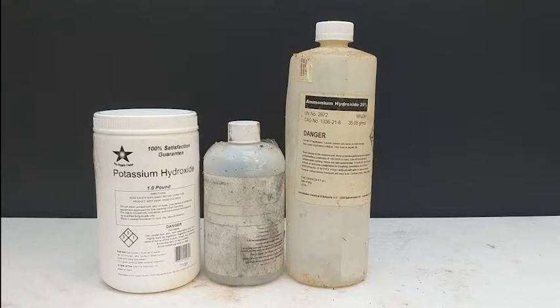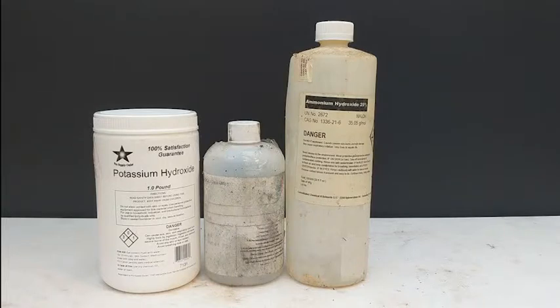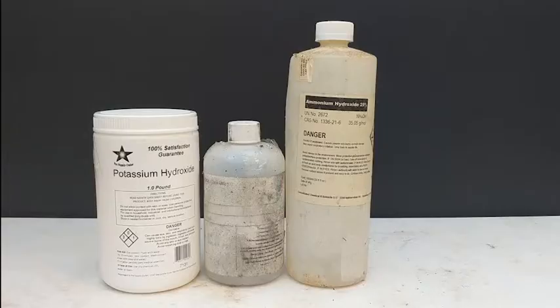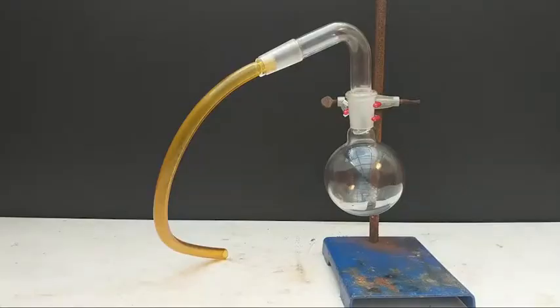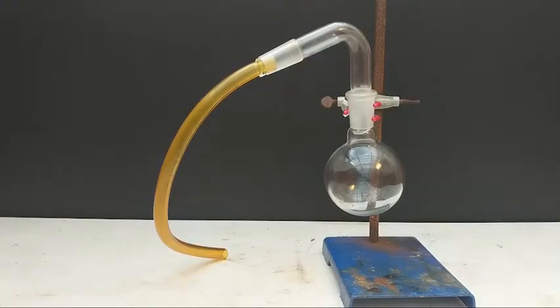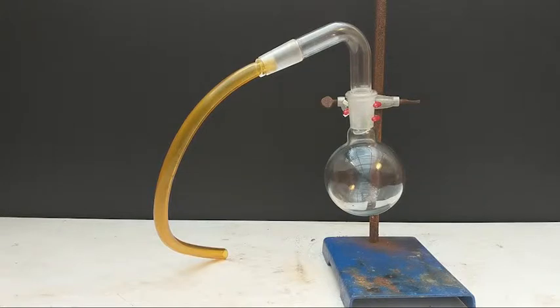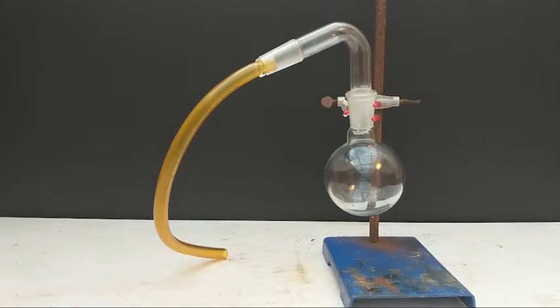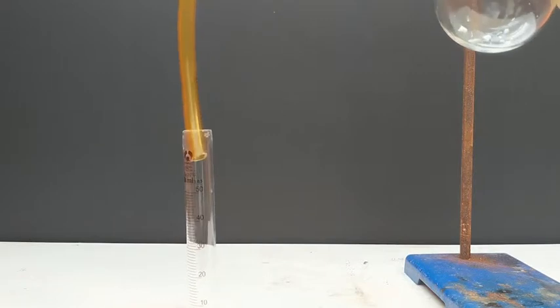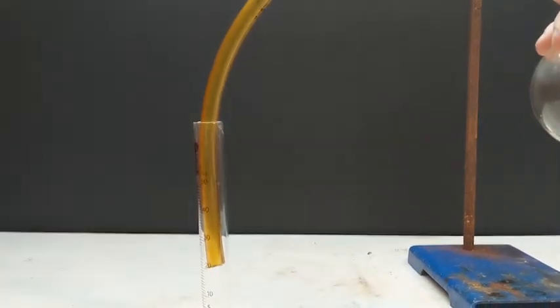We are short of chemicals on hand and have decided to make the ammonium acetate with a rather unorthodox method. We will react potassium hydroxide with ammonium hydroxide to create ammonia gas. The gas will be bubbled through glacial acetic acid, forming the acetate of ammonia.